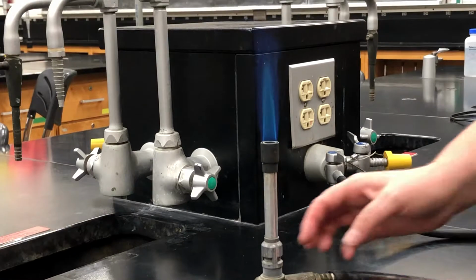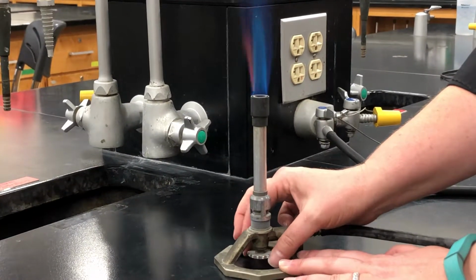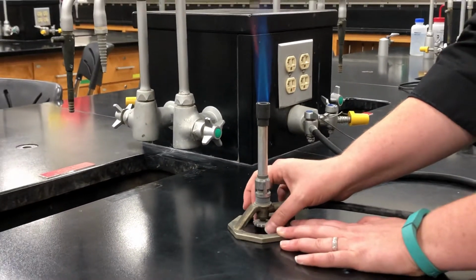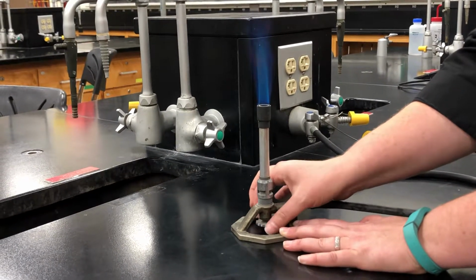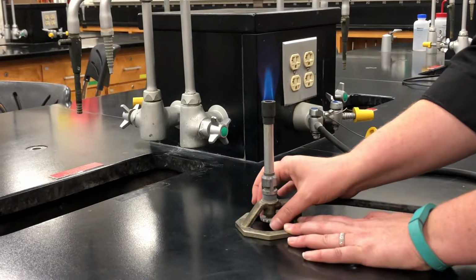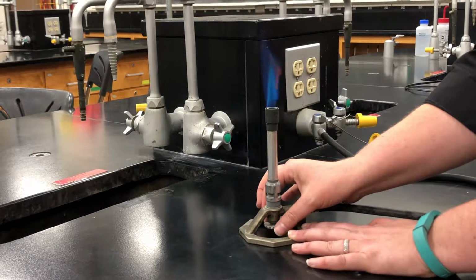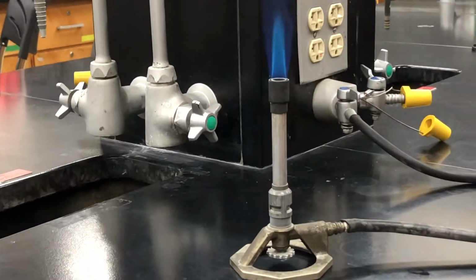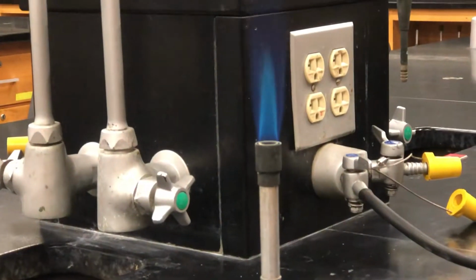So to adjust the height, we're going to use our valve on the bottom. And I'm turning the valve to limit how much gas is going through, and it makes our flame slightly smaller. And right there is about a good height that we want. So we have a good air to gas ratio and a good height, and we are ready to heat up our reaction.